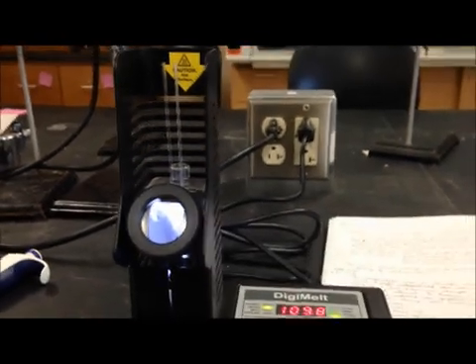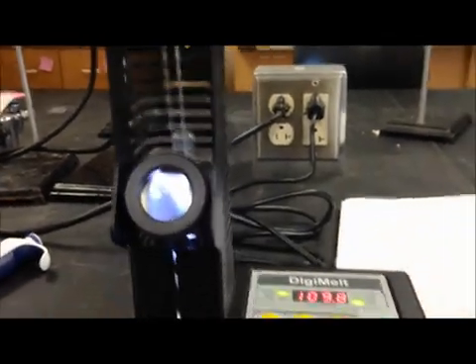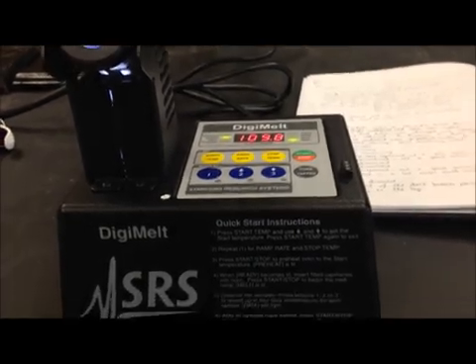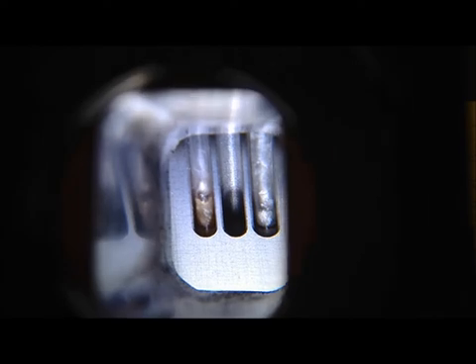I'm going to walk you through how to take a melting point using our Digimelt melting point apparatus. You can see in the viewfinder that on the left hand side I have an impure sample of acetanilide and on the right hand side is my recrystallized acetanilide. I know that my purified should melt at about 114, so I'm going to compare how the two melt to test the purity of my recrystallized.